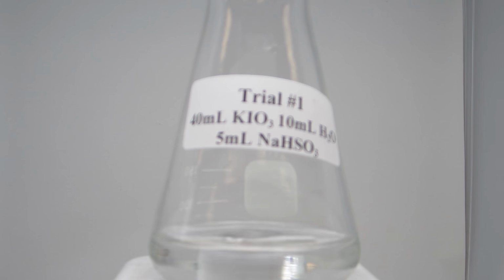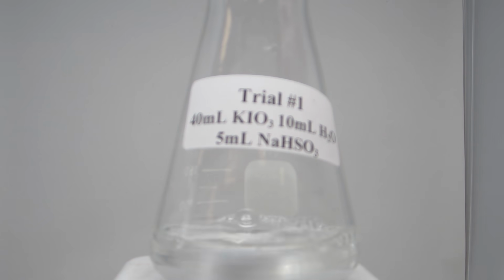In the next trial, we are using 40 milliliters of potassium iodate and 10 milliliters of distilled water, while still maintaining a constant 5 milliliters of sodium bisulfite. By holding all but one variable constant, we can selectively determine what change the concentration of iodate has on the rate.